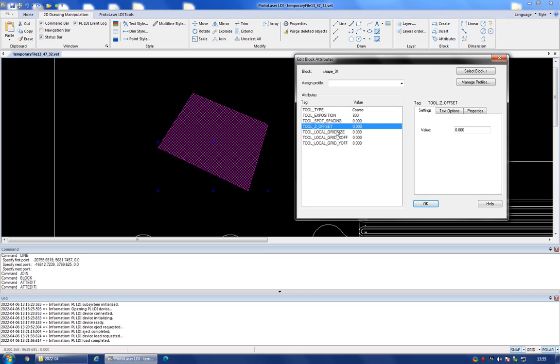And then you've got these three settings, which I'm not very familiar with, which I use to adjust the grid locations and to possibly correct for some stitching errors when the laser writer exposes different grids within your drawing. So for this, you can refer to the manual of the machine.